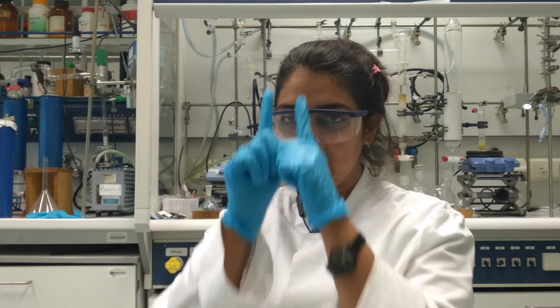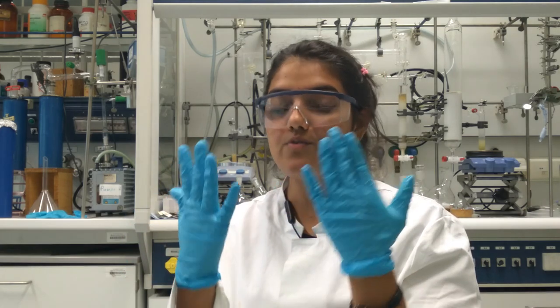Before starting the column, you have to make sure that the column should be very straight, and for that you need to clamp it with two clamps. And of course, you need to wear lab coat, gloves, and glasses for protection.